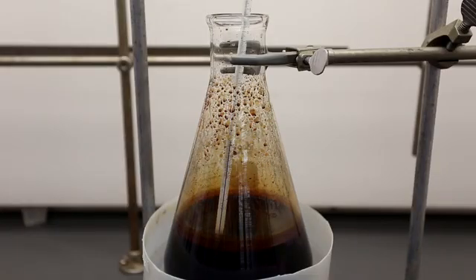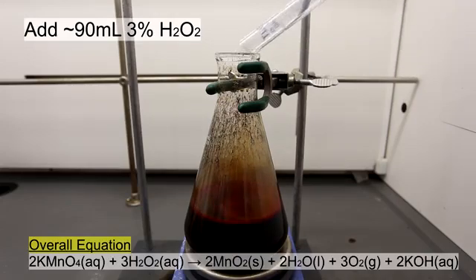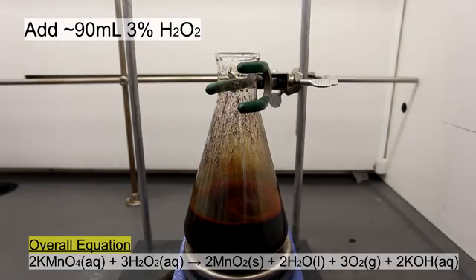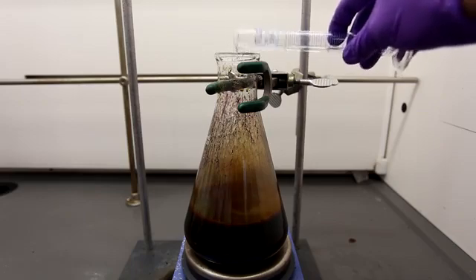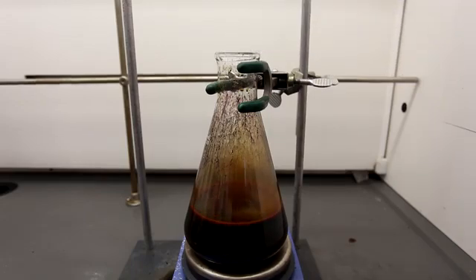By the next day, you could see that a lot of the KMnO4 had been reduced to MnO2 and had become brown. However, when tested by dipping in a pasteur pipette, it is possible to see that the solution still contains a lot of KMnO4. The KMnO4 remaining in solution was neutralized by the addition of about 90 milliliters of 3% hydrogen peroxide, which was added in small additions. In the interest of time, only a few of the dozen additions were actually filmed.